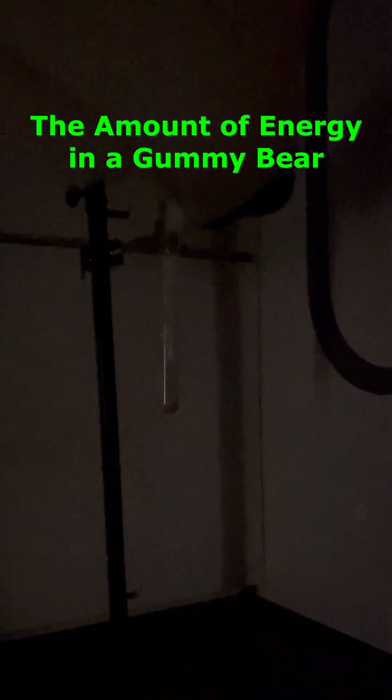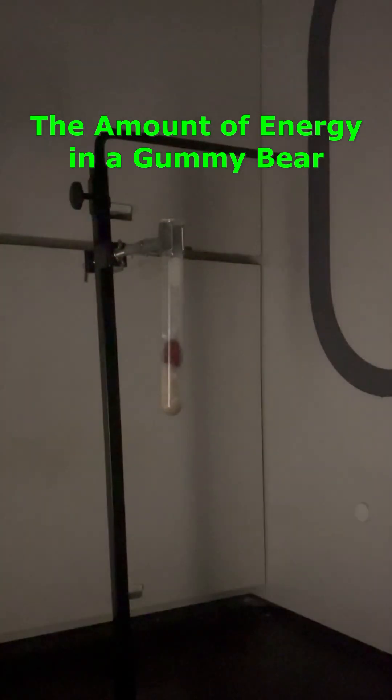Since gummy bears are made mostly of sugar, I was wondering how well they would react. And so I dropped one in.